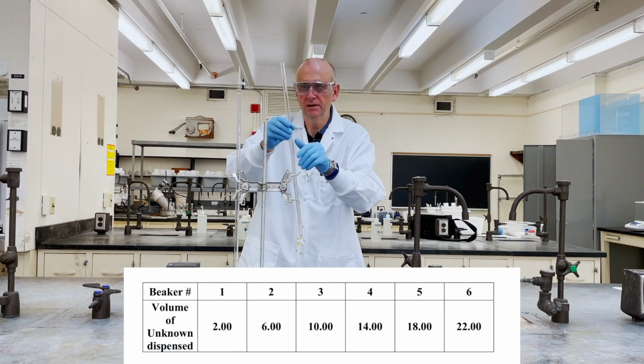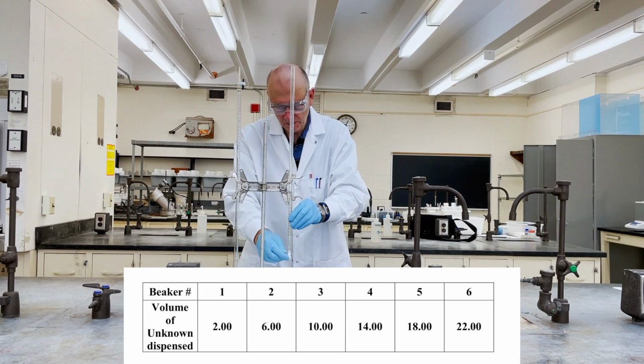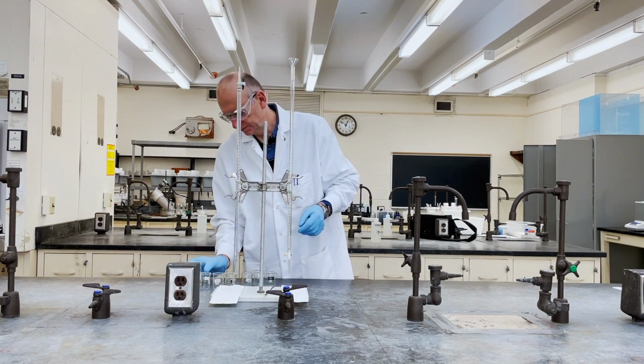To begin, fill the glass burettes with the unknown solution. Make sure the burette is properly zeroed before dispensing the following volume of the unknown solution into the small beakers.